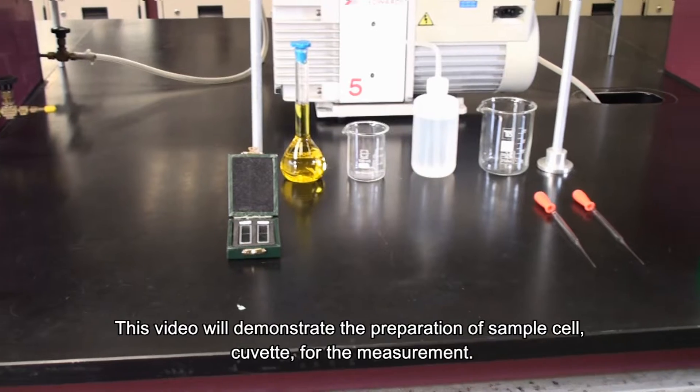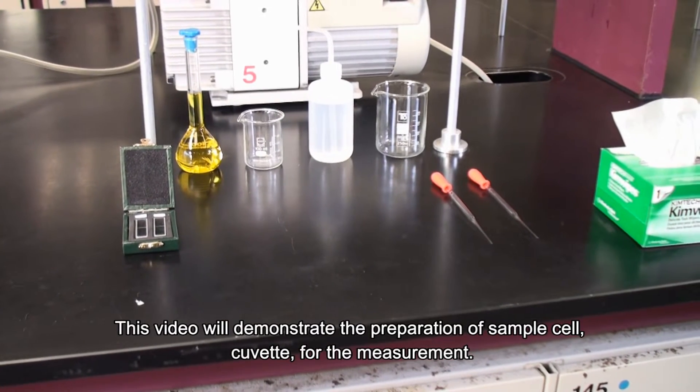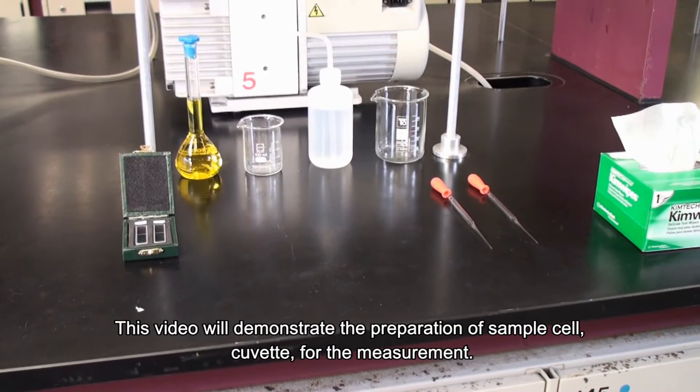This video will demonstrate the preparation of sample cell, cuvette, for the measurement.